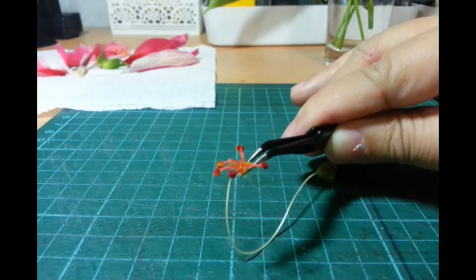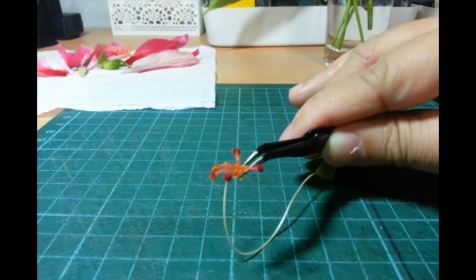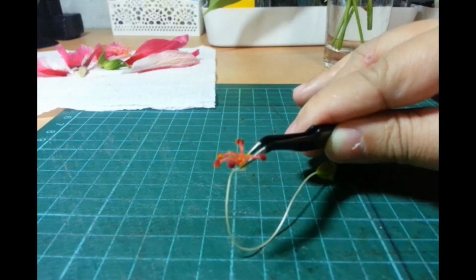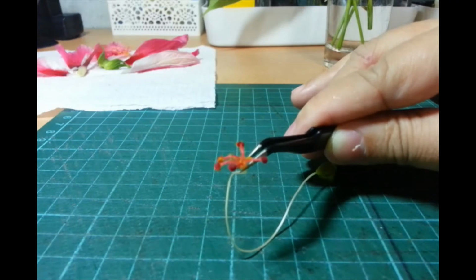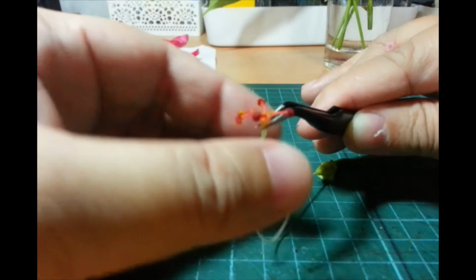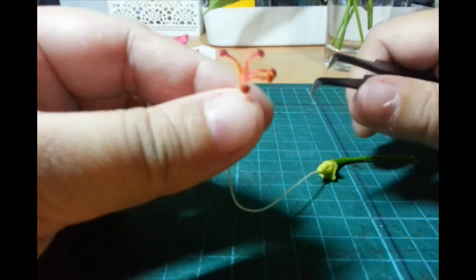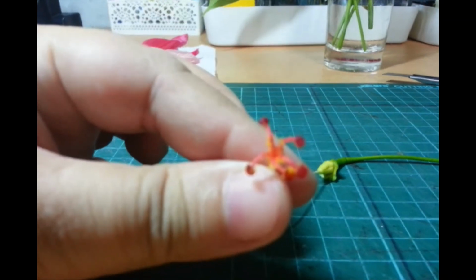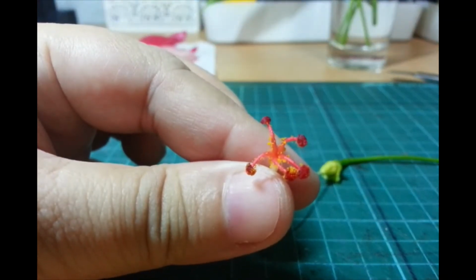Layo. Okay. So, mas kita nyo pa yung malayo. So, the parts there that have yellow, yan na yung pollen. Okay? So, yung red, yun yung stigma. Tapos, yung yellow na powdery stuff, that's already the pollen grains. Nandun na sila sa stigma. Most of the time, the stigma is sticky. So that the pollen grains will adhere to them. Okay? Ayan!